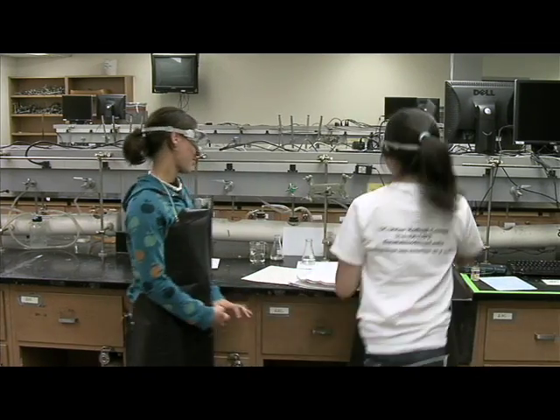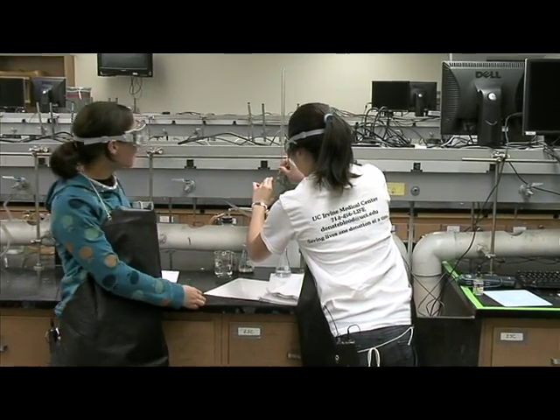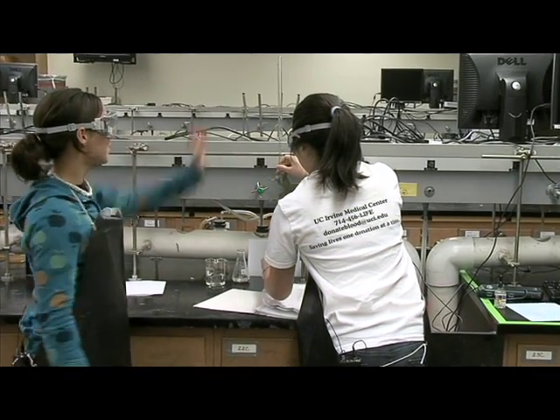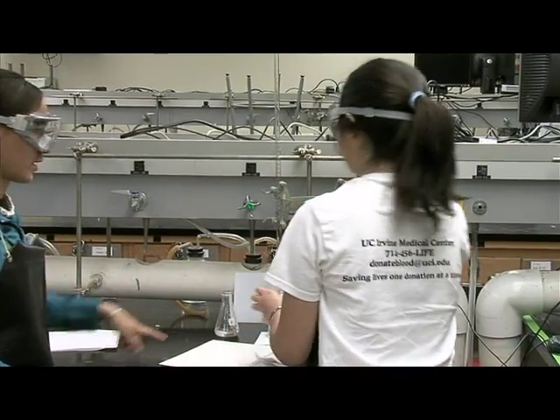I got it! Okay! So it says to attach it to the ring stand and then fill it up with a titrant to the zero. Okay. That's the analyte.